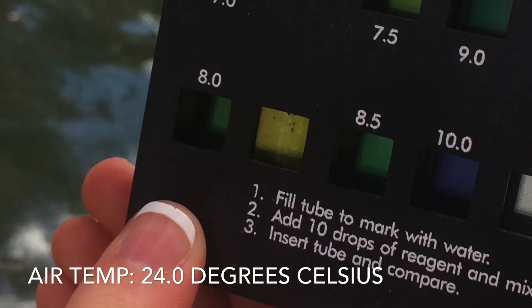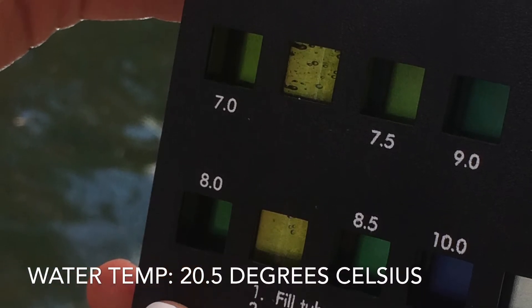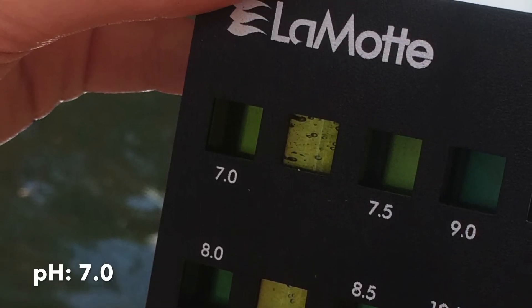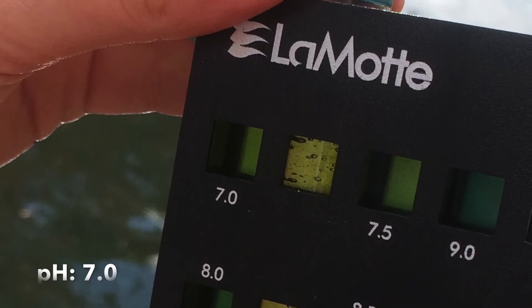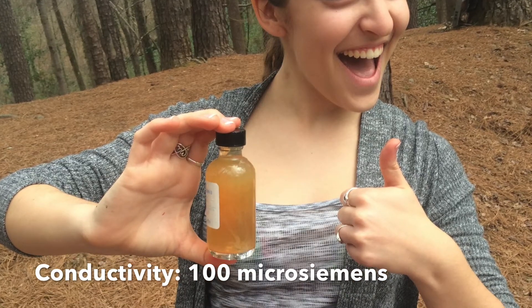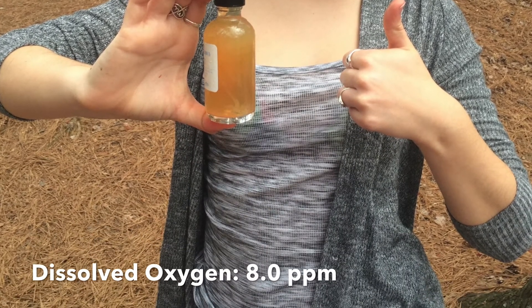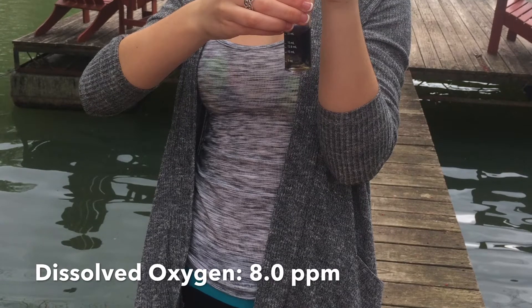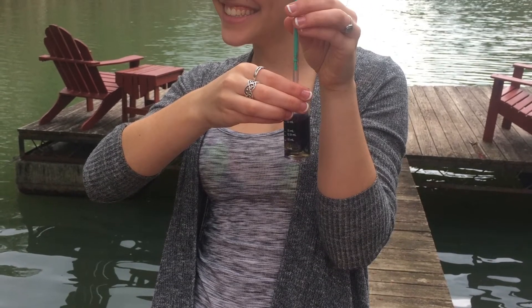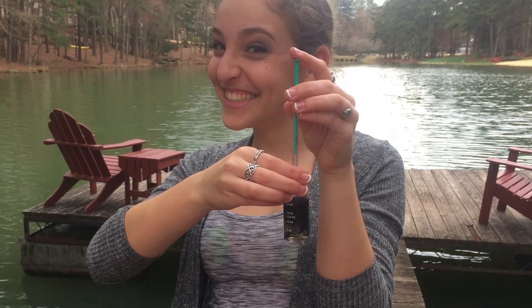After doing air temp and water temp measurements, I did the pH test, which was 7.0. Next came the conductivity, and then everyone's favorite, dissolved oxygen levels. I found that I was much more comfortable doing this alone than expected, because of all the times that we did this in class together.